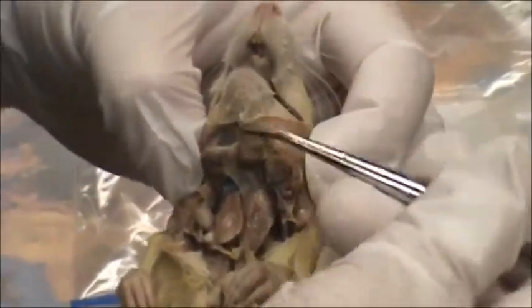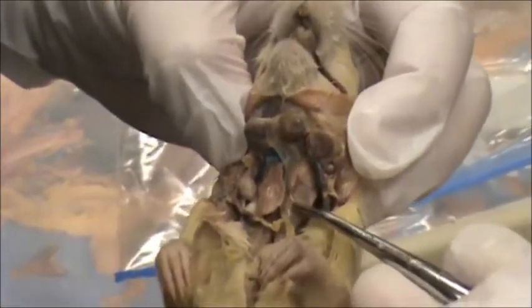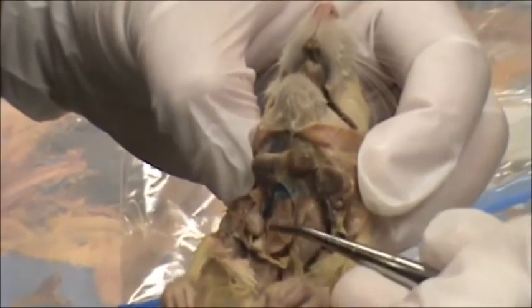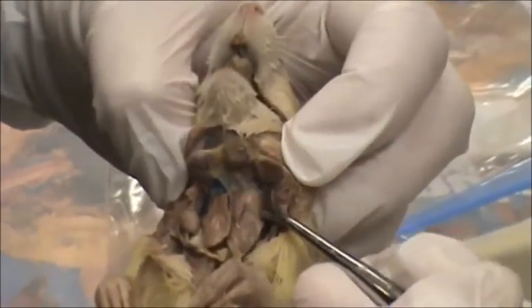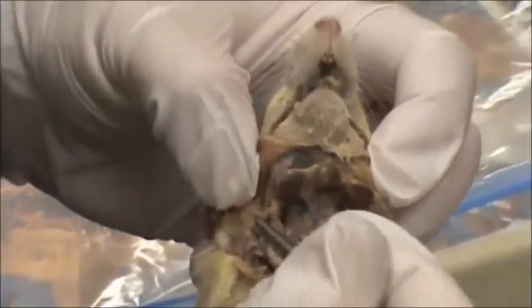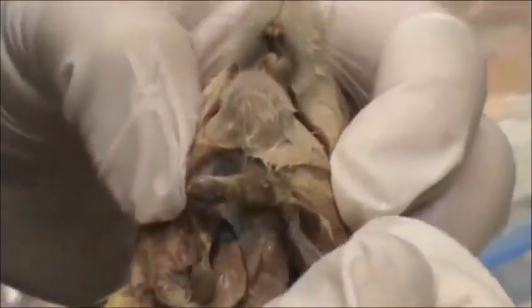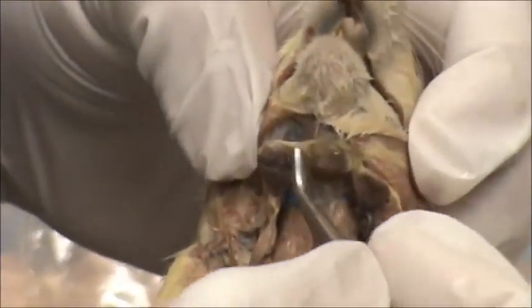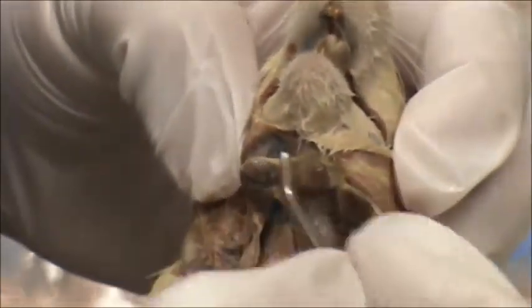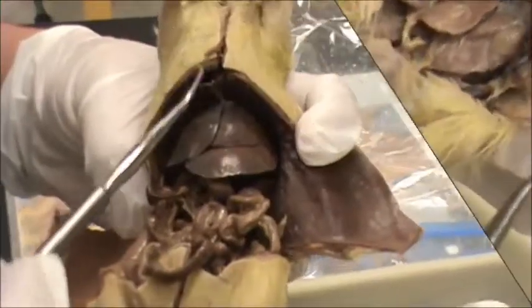Here in the neck area we just cut open the skin and peeled it back. You can find the salivary glands — there are three salivary glands. There are the submaxillary; on top or attached to the submaxillary is the sublingual; and then on this side here is the parotid. These little round balls are called lymph nodes, and they are part of your lymphatic system — they are like your tonsils. Humans have lymph nodes in their neck region, and they concentrate infection inside there, and the white blood cells destroy the pathogen.